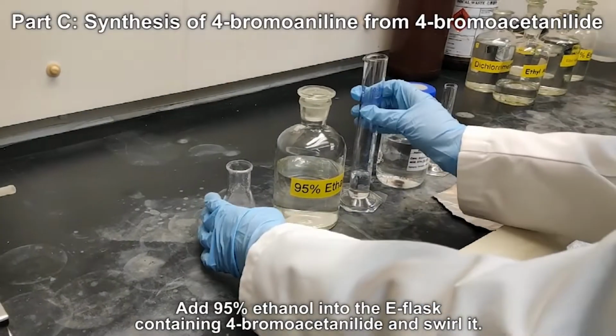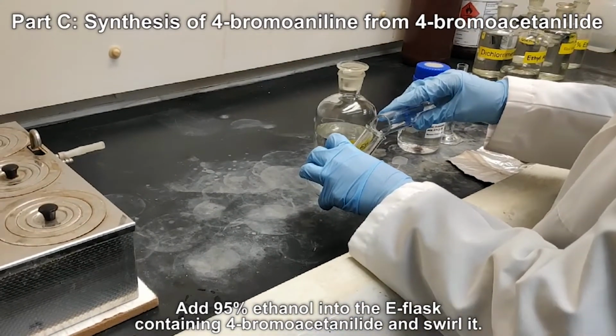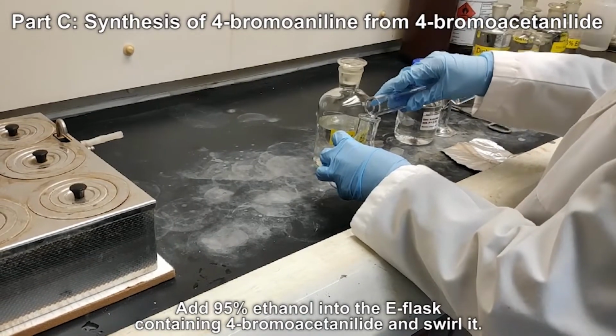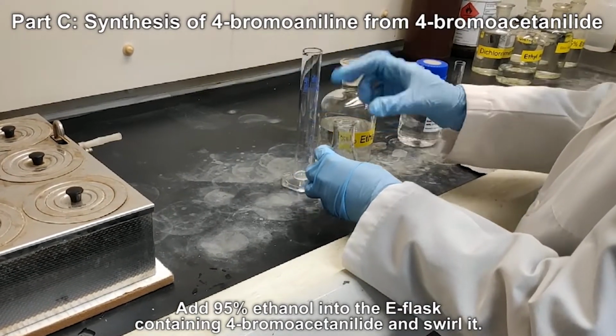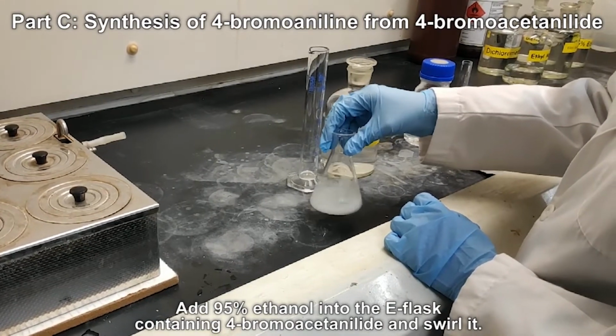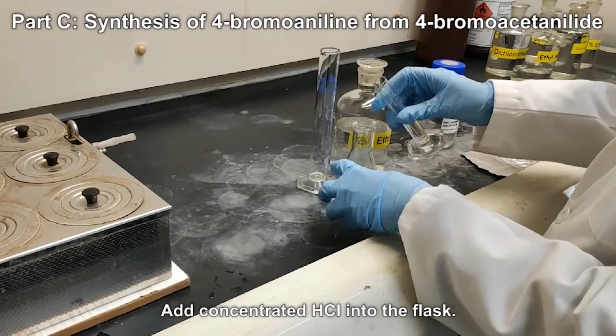Add 95% ethanol into the E-flask containing 4-bromoacetanilide and swirl it. Add concentrated hydrochloric acid into the flask.